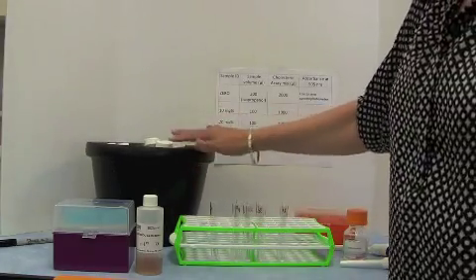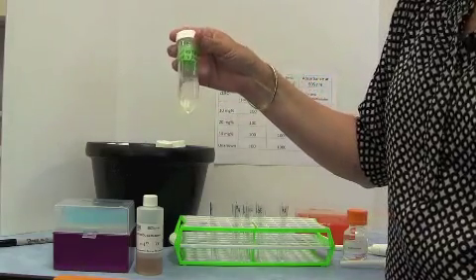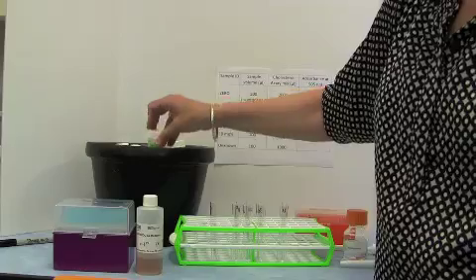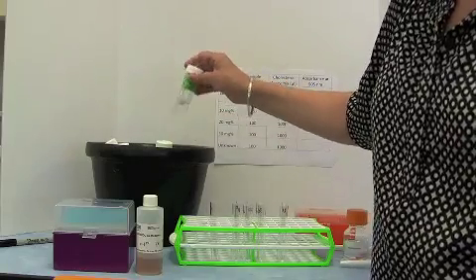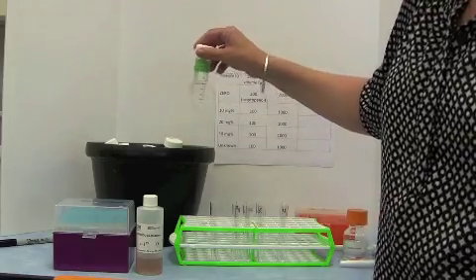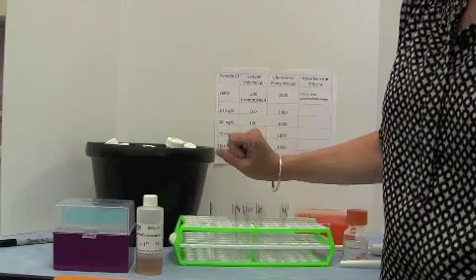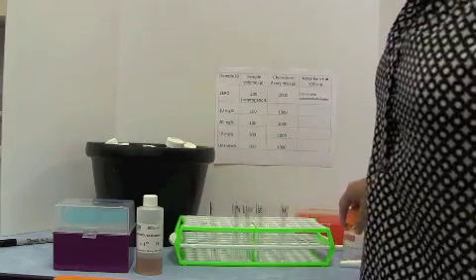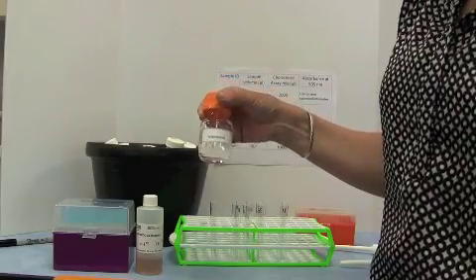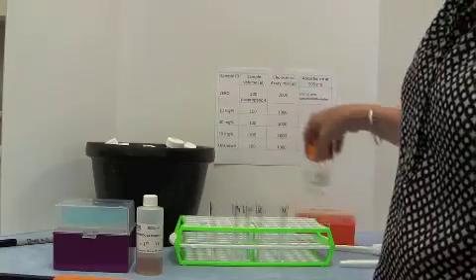We have a series of solutions in the ice bucket here. We have our cholesterol standards: one at 10 mg%, one at 20 mg%, another at 30 mg%, and finally our unknown, where we don't know what the cholesterol concentration is. You'll actually be given smaller volumes, in little Eppendorfs. The other thing we have is some isopropanol in a bottle labelled isopropanol, and that is for making your standards, or rather, for making the zero.